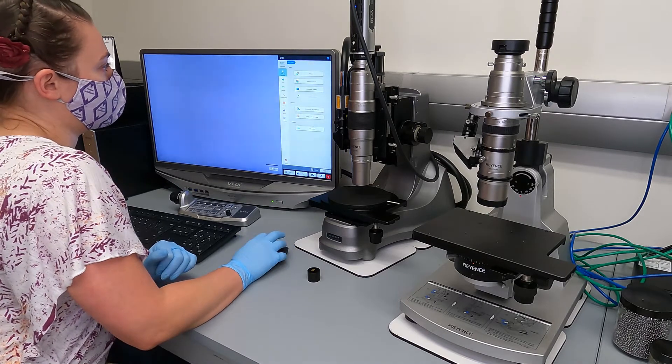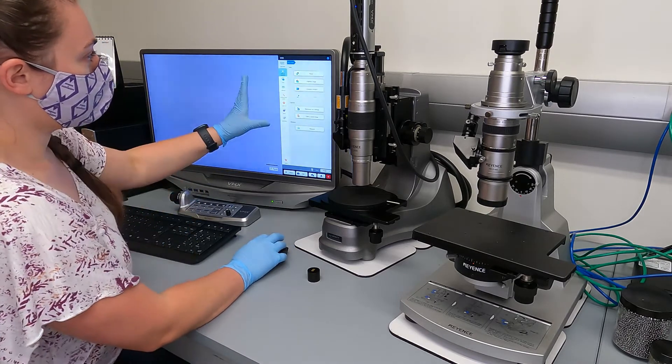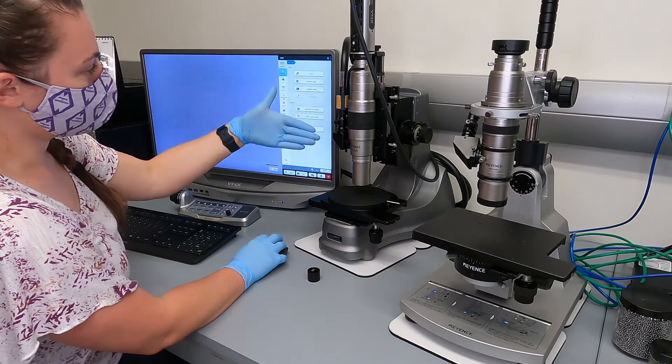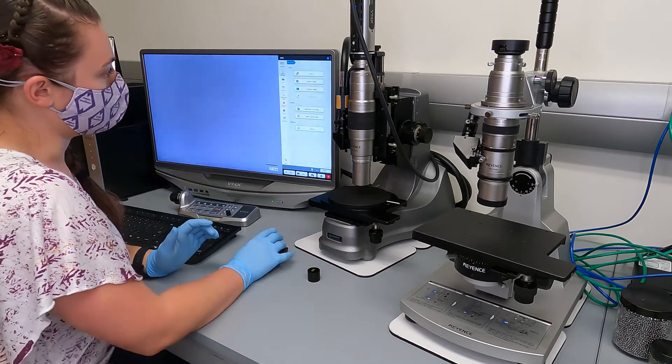Like the VHX600, it does not read the magnification automatically as of right now. So you do have to make sure that you manually put in your magnification anytime you change it, so that your scale bar will be correct. OK, so we have our options over here on the right-hand side.